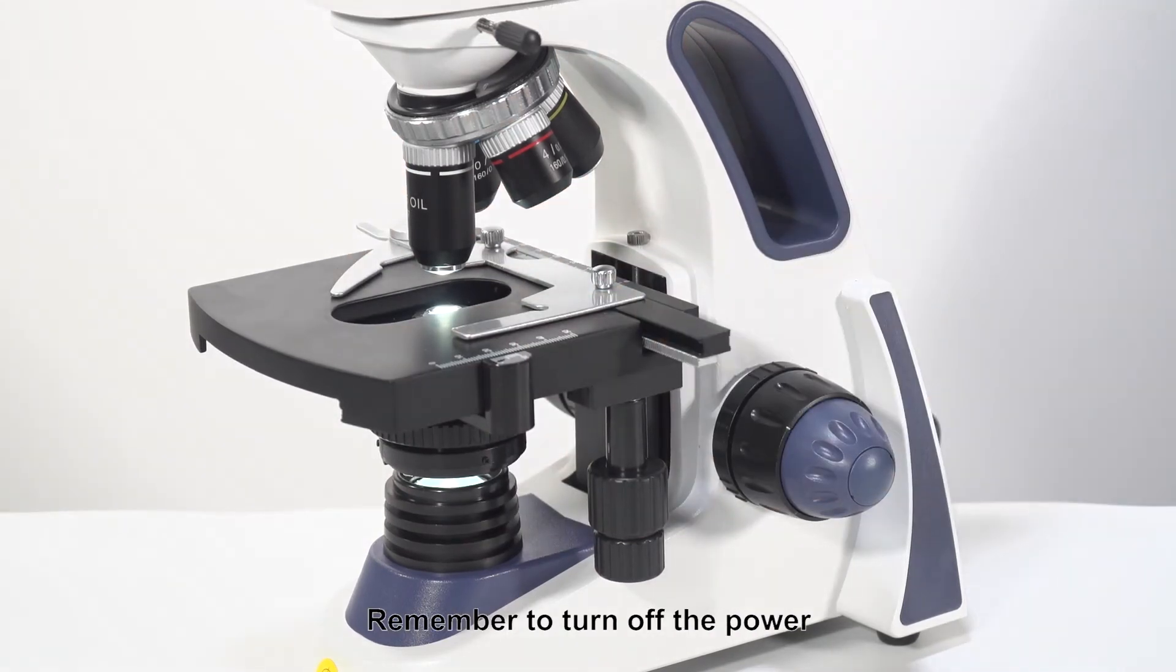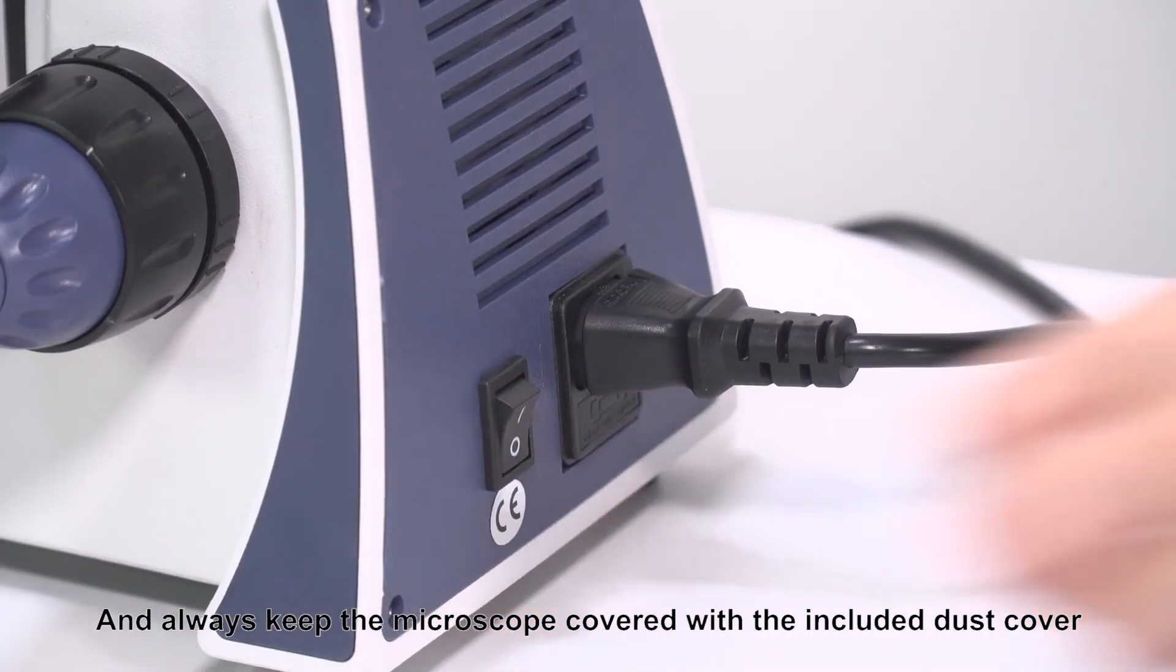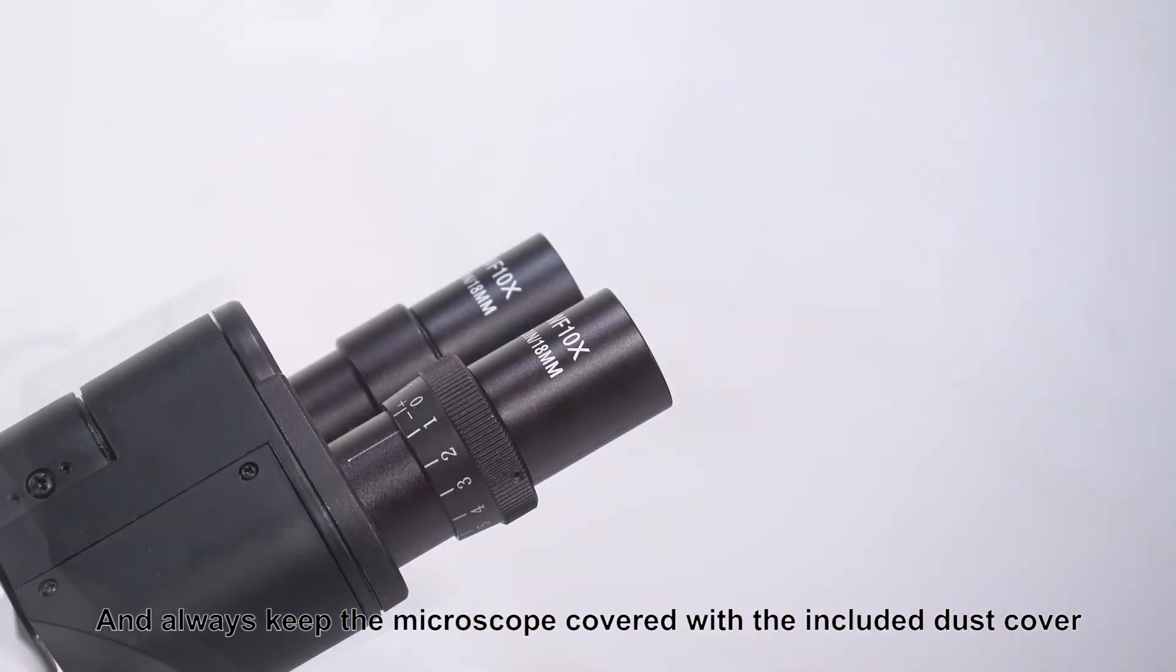Remember to turn off the power and always keep the microscope covered with the included dust cover in order to protect the eyepieces and objectives.